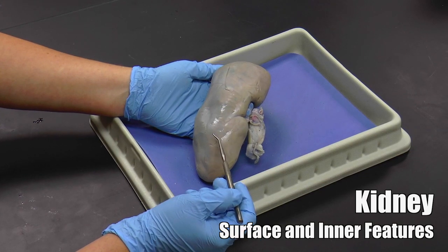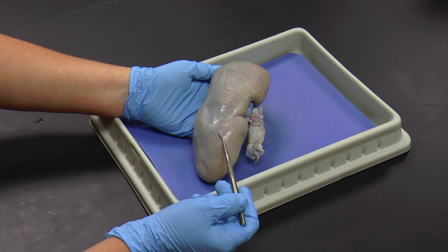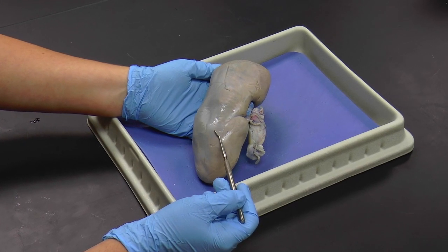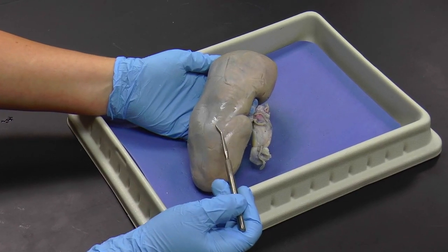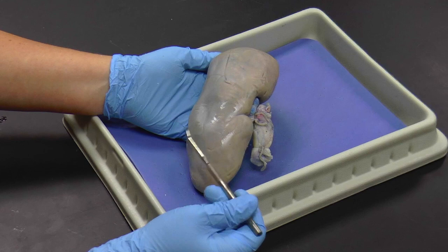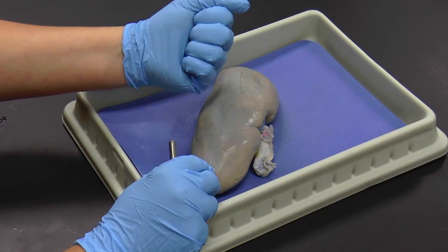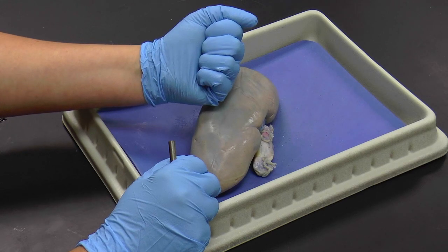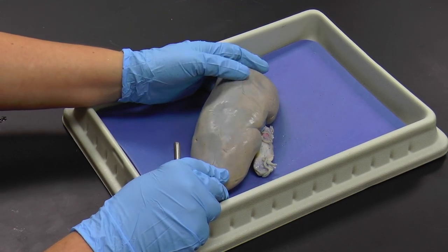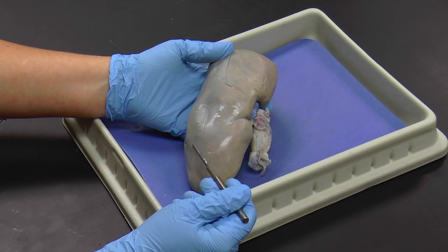We're going to look at the surface features of a kidney. In this case we're looking at a pig kidney, which we're using for comparative anatomy. It has all the same structures as your human kidneys. However, the pig kidney is quite long. Just to give you a sense of size, the human kidney would be about the size of your fist. Because the pig has a larger body mass and more blood, it's going to require larger kidneys for filtering that blood to produce urine.